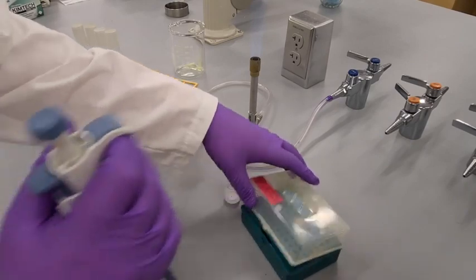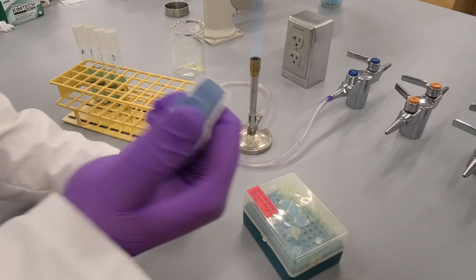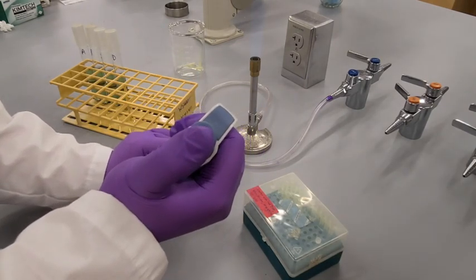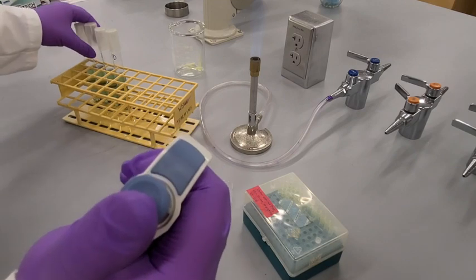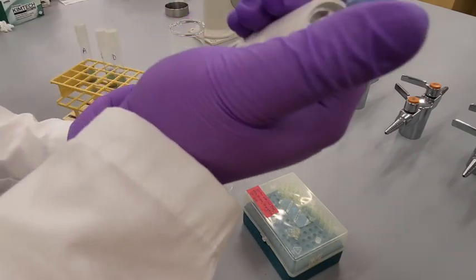So to start I'm going to take 200 microliters of saliva and I'm going to put this into tube B. Tube A is going to be our control tube.